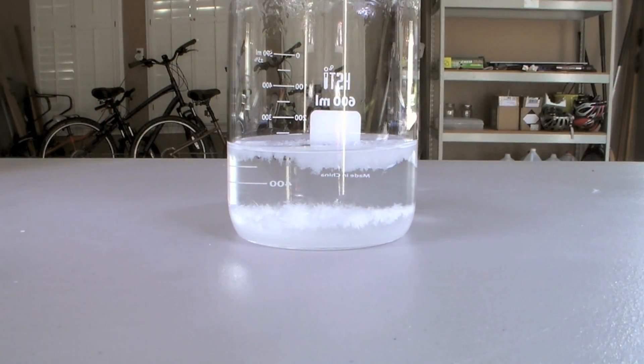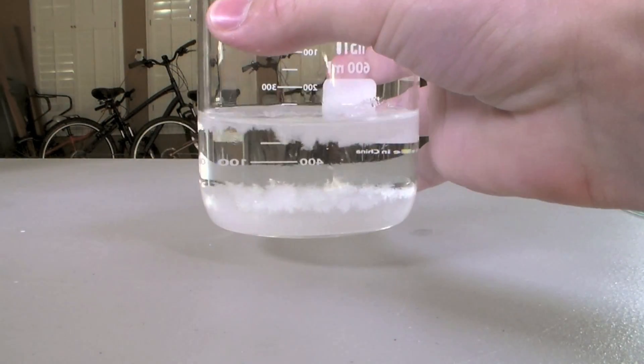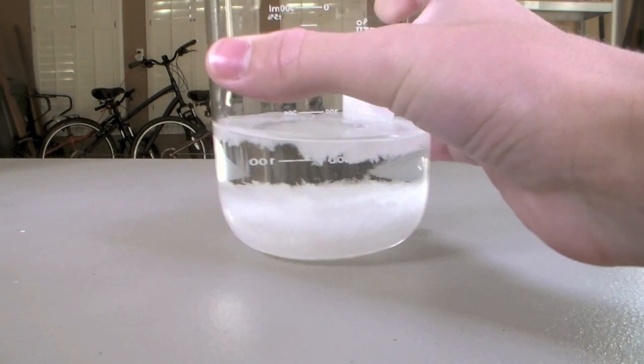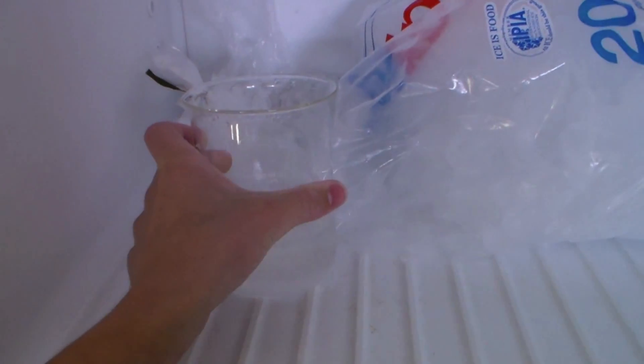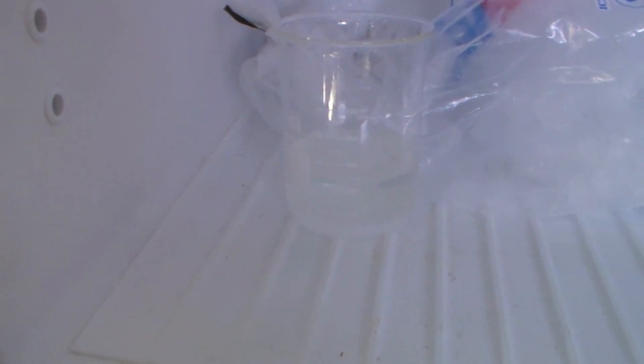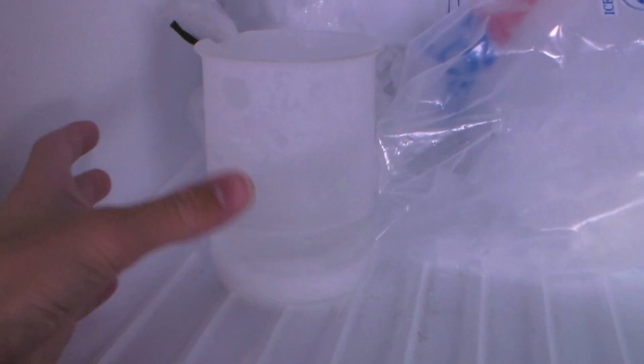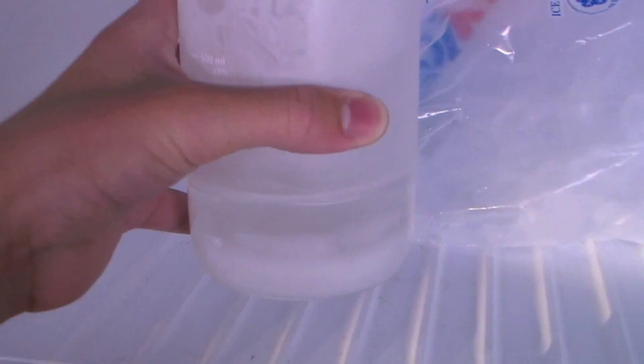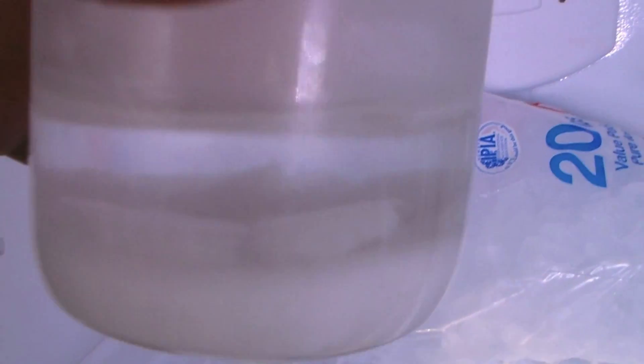To squeeze the last bit of crystals out of the solution, the beaker was placed in a freezer and cooled to zero degrees Celsius. And after cooling, there are significantly more crystals on the bottom of the beaker.